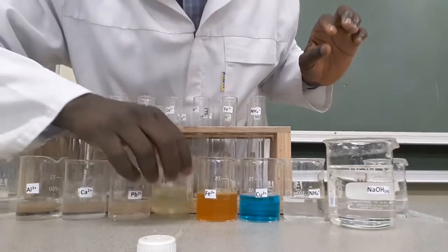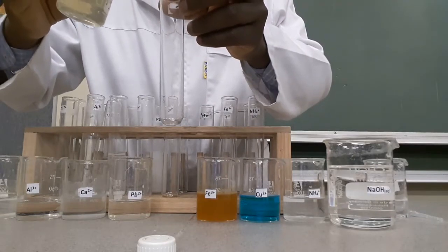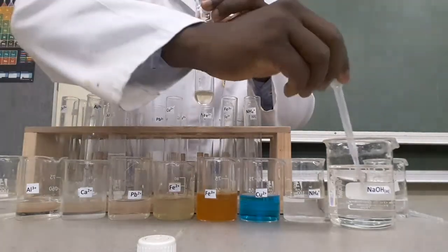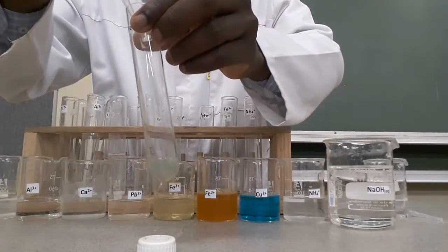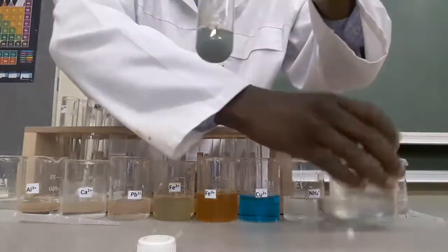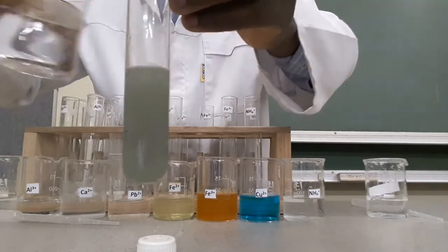The next cation is iron(II) ions. We want to observe the effect of sodium hydroxide on iron(II) ions in solution. Add a few drops of aqueous sodium hydroxide — there is a green or dirty green precipitate forming. Adding excess aqueous sodium hydroxide: the precipitate is insoluble in excess.